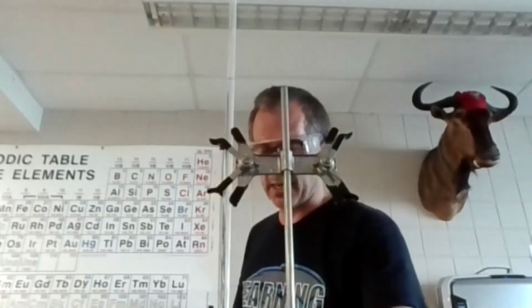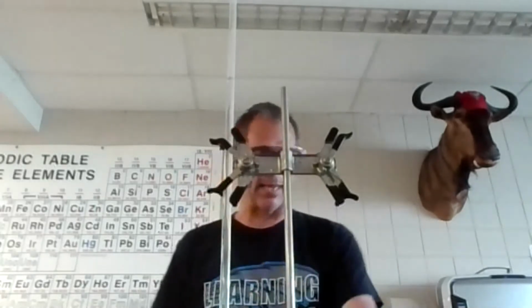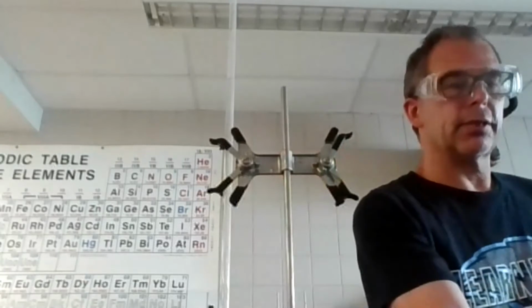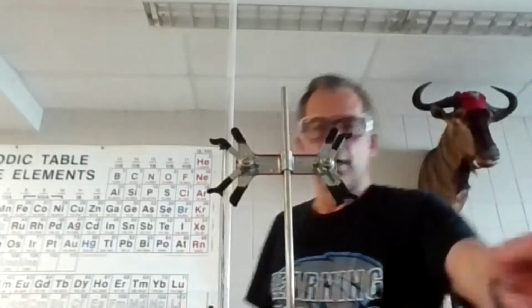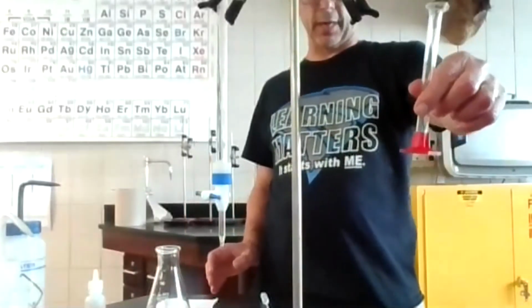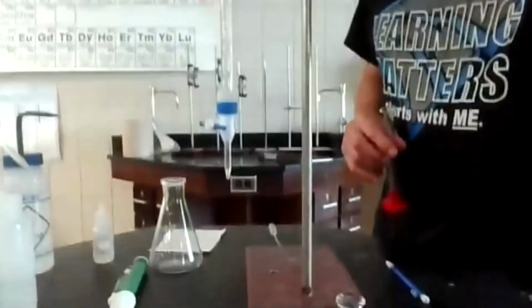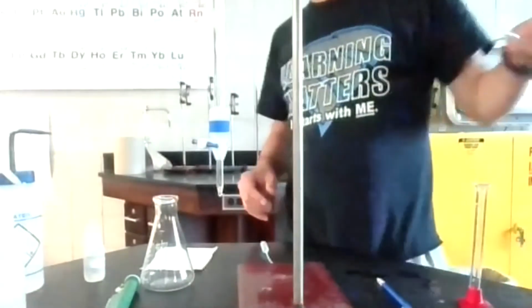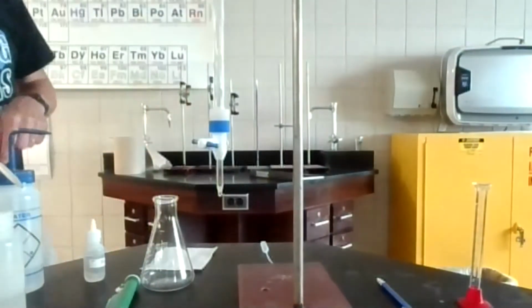Okay, with that in mind, now I got to get my acid and I got to get it in this flask. I rinsed this out. It's got a little water residue there. I'm not even worried about that. And now I could rinse this out really good and use a grad cylinder. That would be pretty accurate to do. Or I could use this pipette, and especially since you had one that wasn't open yet, you could use that right away.